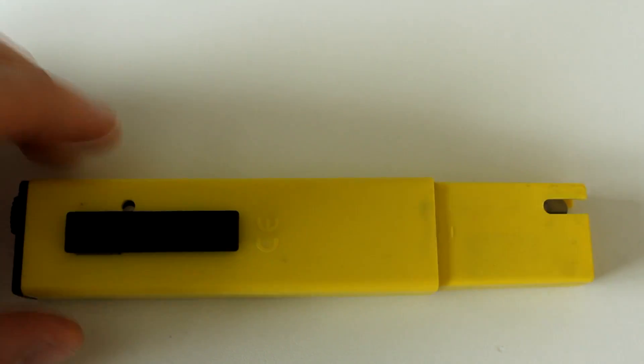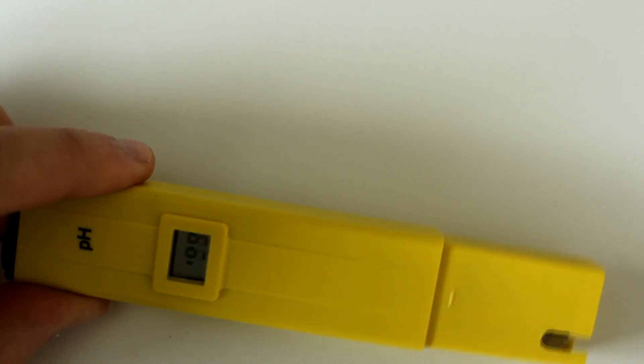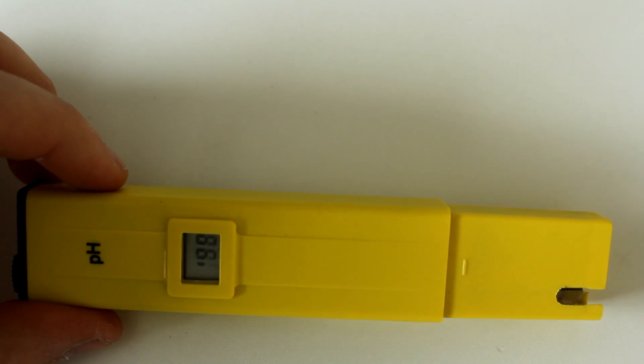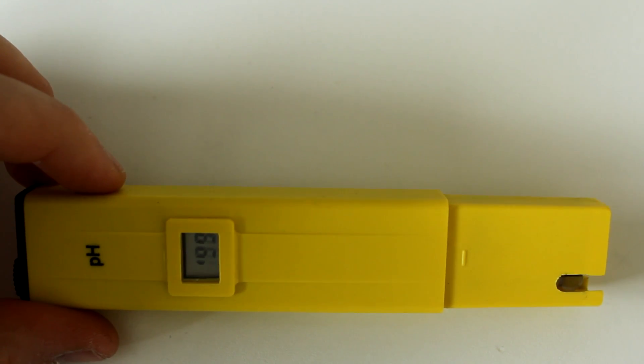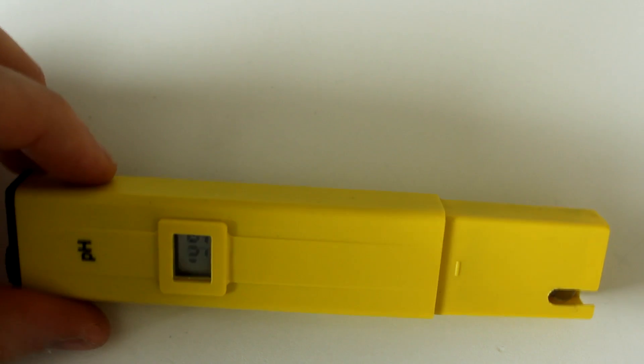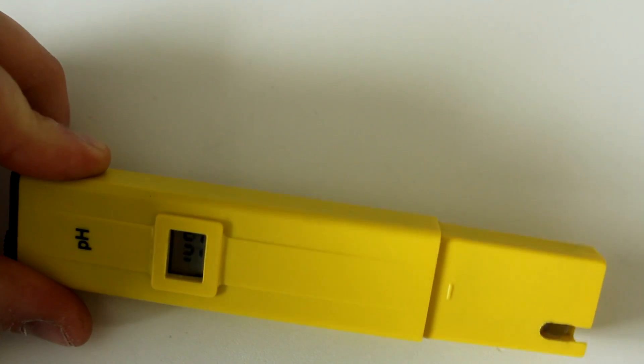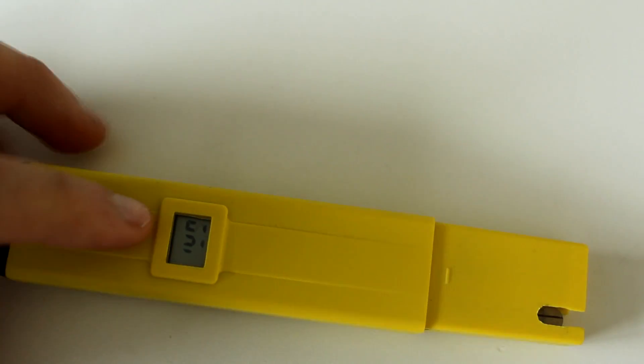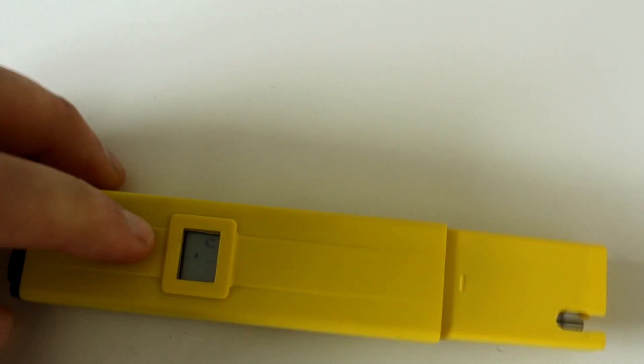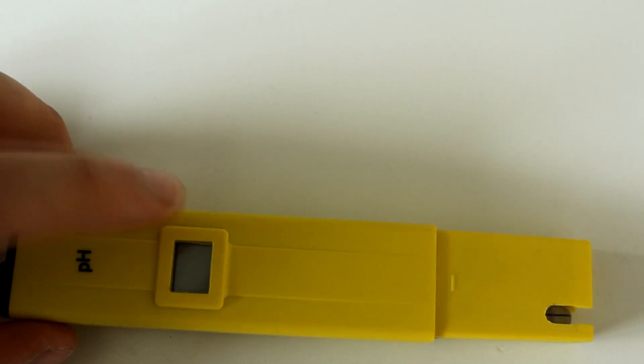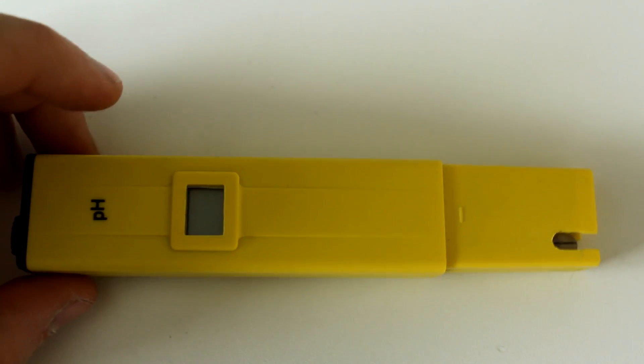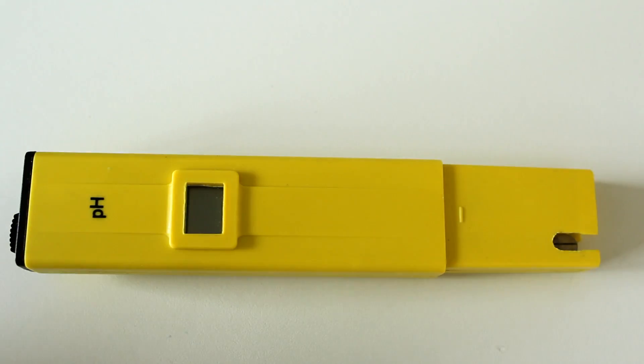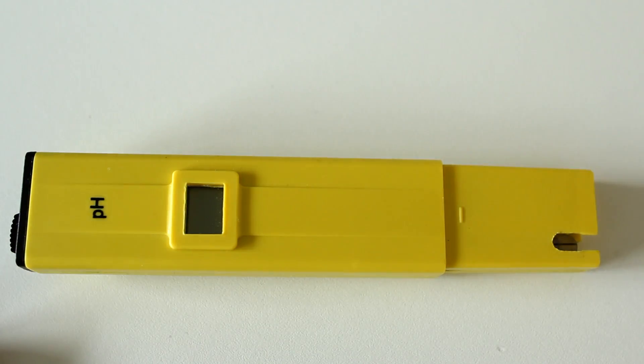And did a number on the PCB. Right now it's essentially completely broken - it just says 188 and kind of fades as well, so it's definitely broken in some big way. We heard some fizzing going on inside the pH meter, so let's take it apart and see if it's repairable or at least see how it works.